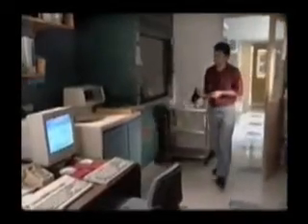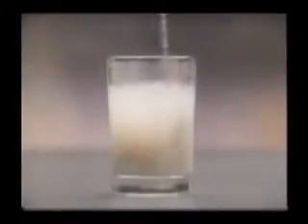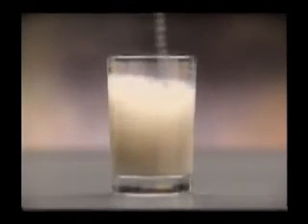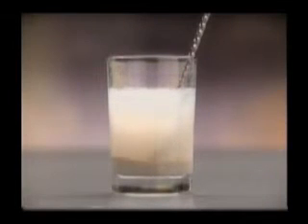Analytical ultracentrifugation relies on the fact that particles in solution will sediment if acted upon strongly enough by a force, like gravity. The reason we want to make the particles move in the gravitational field is we can learn a lot about the size and the shape of the particles as they move in the field. Particles that are denser than the solution in which they're suspended will eventually sediment to the bottom of their container, like this sand does in water. Sedimentation is caused by Earth's gravitational field acting on the sand particles.